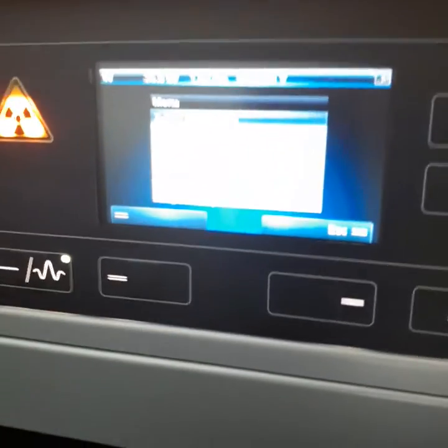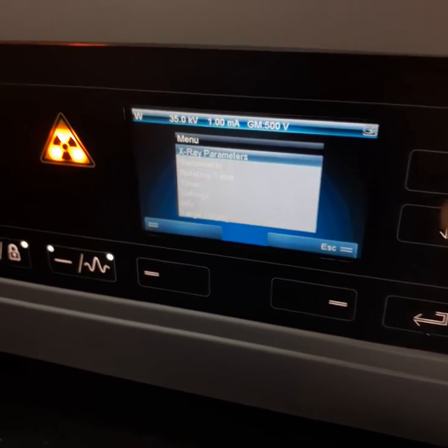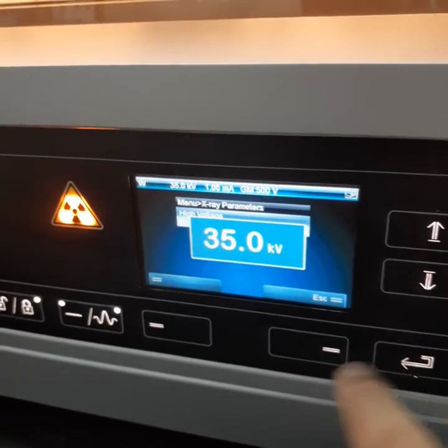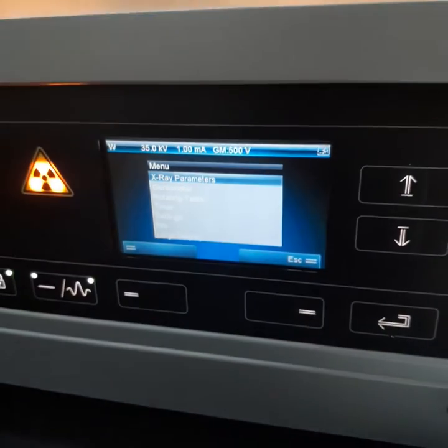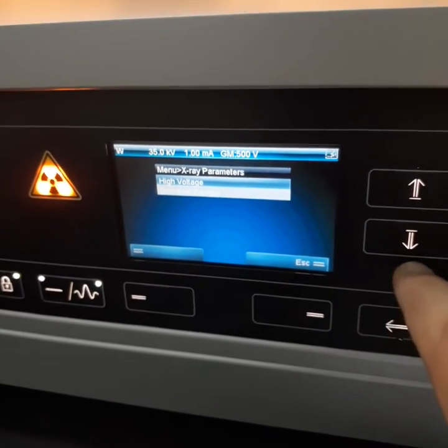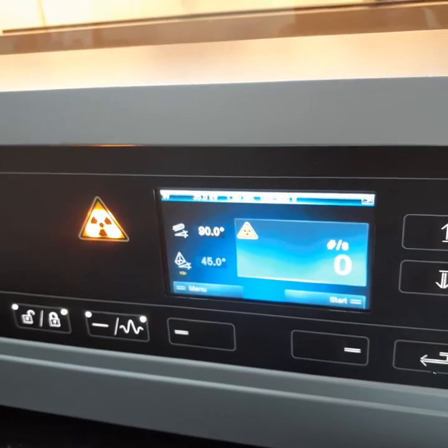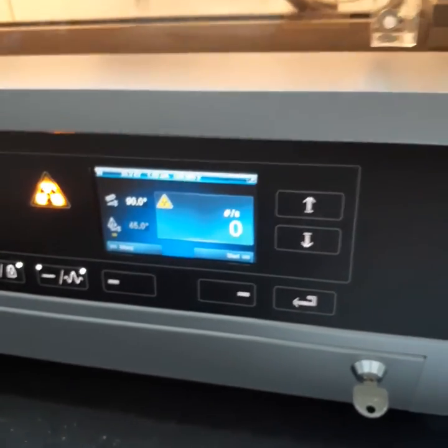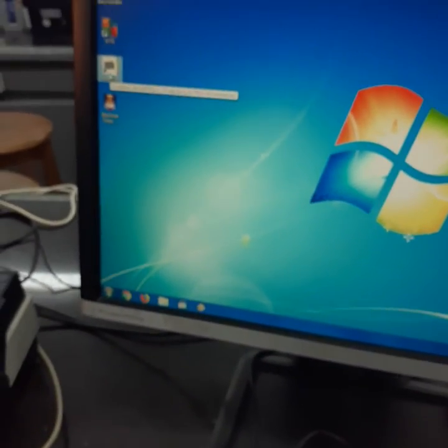Now these values here, you can see, now it appears very well. X-ray parameters, now high voltage is 35 kilovolt. We will go back to the X-ray parameters, the current is 1 milliampere. I think now everything is working properly. Now we are using the Measure Lab software. Let's open it now.